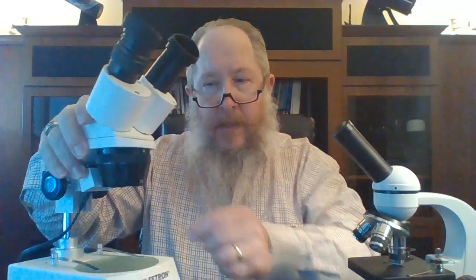For larger objects, such as are commonly viewed with stereo microscopes or stereoscopes, you're looking at something that's actually large enough to hold in your hand and place on the stage directly. You would look at rocks, flowers, fossils, coins, stamps, industrial pieces — these are often used in inspecting industrial components. They tend to be very low in magnification; this particular one ranges between 10x and 60x magnification.